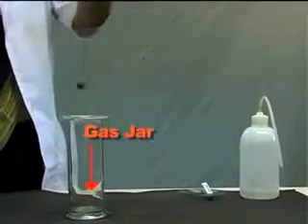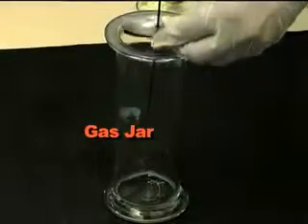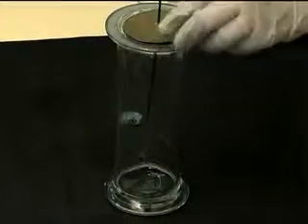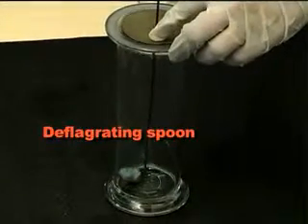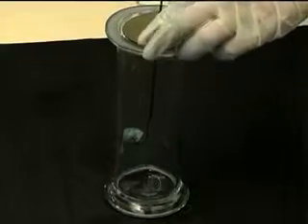What you see here is a glass jar trapping gases and a deflagrating spoon. The spoon contains a circular lid to trap the gases inside the jar.